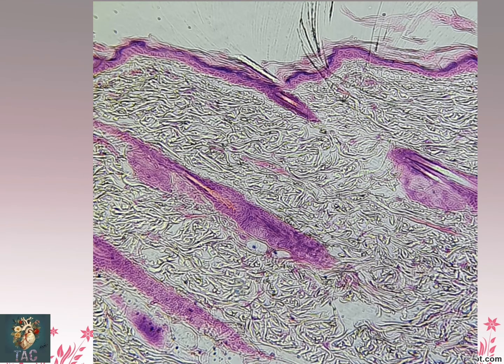Another slide. Here you can see this is the thickness of the epithelium. Again thickness shows it is stratified. You can look at the surface cells, which are squamous in shape, and very clearly you can see the keratin which is present over here. So this is the slide which is taken from the thin skin. It is lined by stratified squamous keratinized epithelium, and here you can see the dermis, which is the dense irregular connective tissue having a large number of fibers which are irregularly arranged.